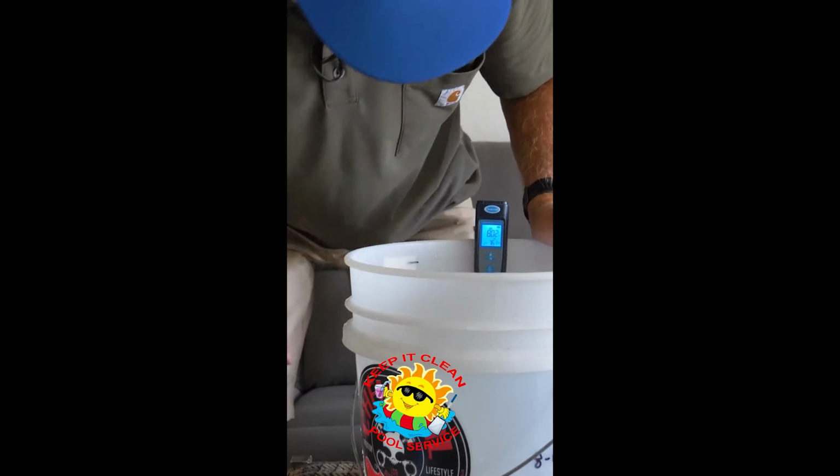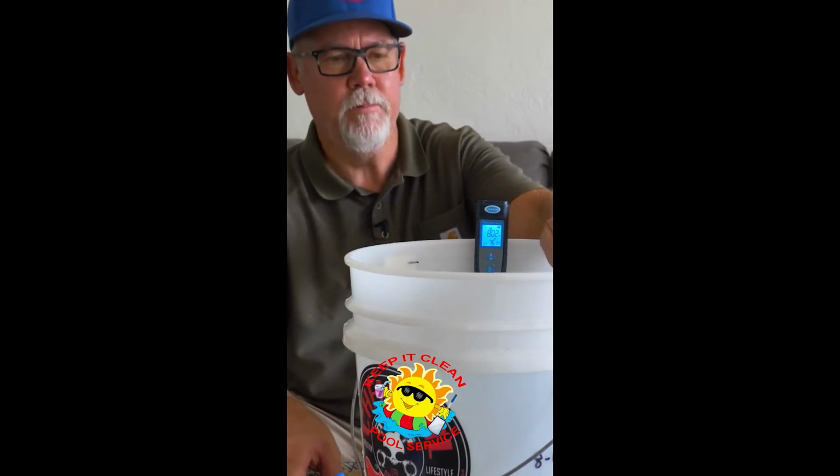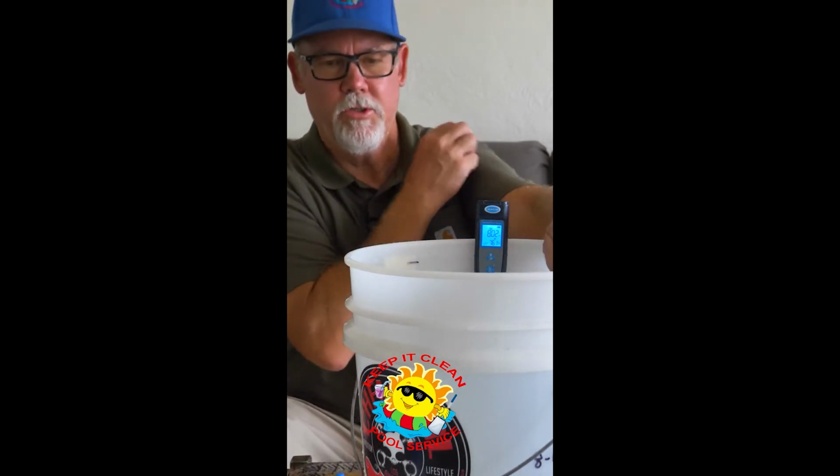what do we have here? An 8.0 pH, okay? So what I'm going to do is add some acid and bring it down to about a 7.5 pH. This does not have any cyanuric acid in it right now. No conditioner at all in this water. And what I'm going to do is find out how many drops it takes to bring the water down to 7.5 thereabouts pH. And then we're going to write that down.